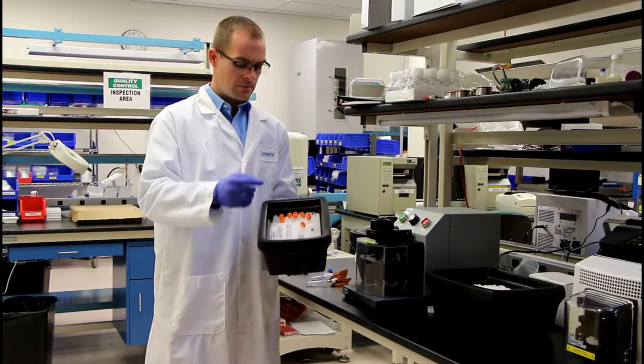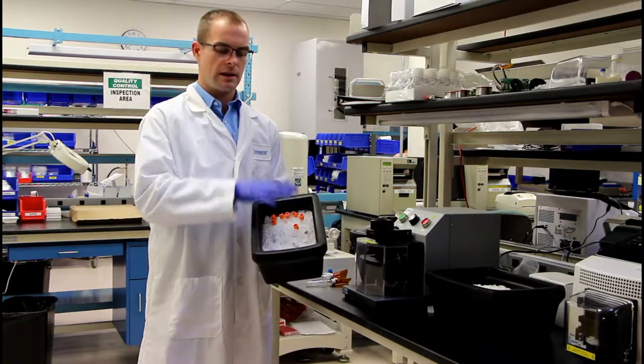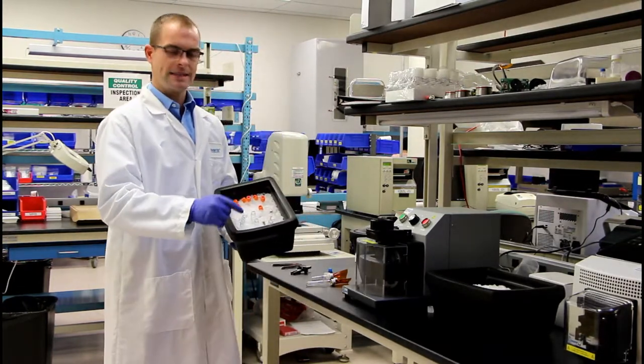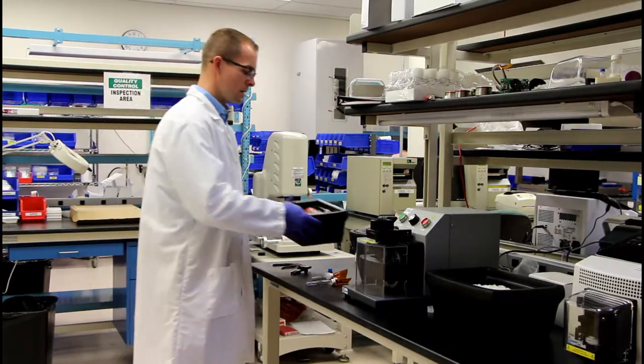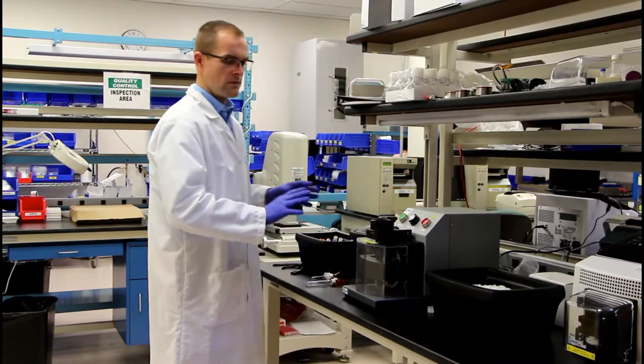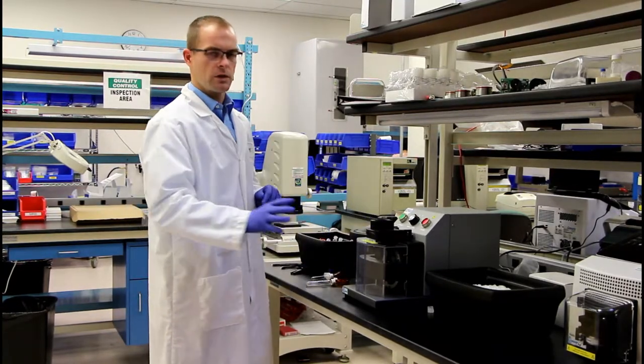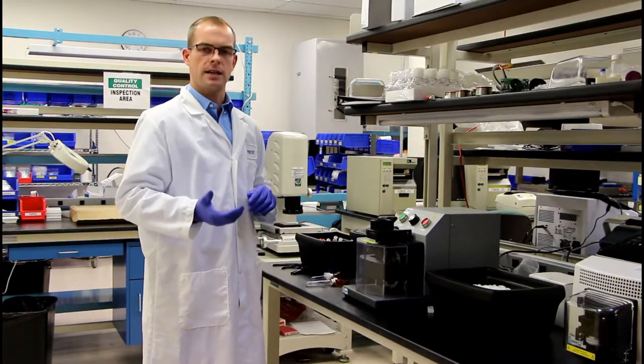You can put your samples on ice in this dewar, and I like to pre-chill the tube as well. It just helps with the sample transfer and it helps with keeping your samples cold. The large benefit of this system and this workflow is to keep your samples cold the entire time.